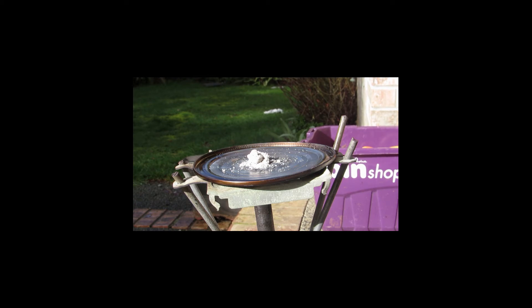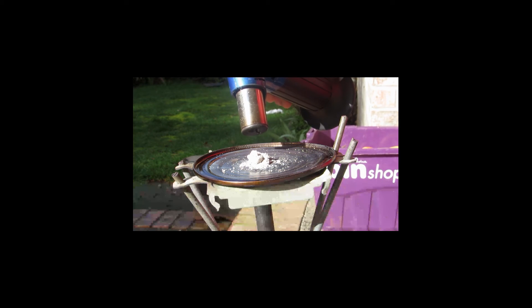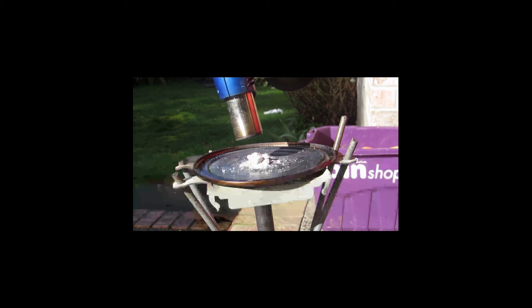And then our silver powder will be able to be melted into a nice small ingot. I'll be back after the silver powder is nice and dry, and then we can get to the melting. There's a glob of silver powder which has been dried out now, just sitting on there. It's in a much finer state than in my previous video, so I think I should be able to melt it with this propane. But I'm not totally sure — if this doesn't work, I'll just use my arc furnace. I have it heated from below, and I'm just going to heat it from on top also.